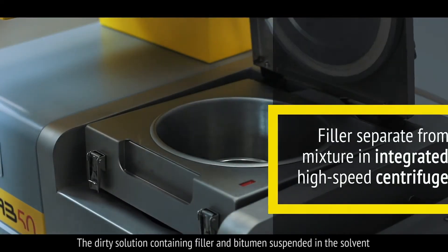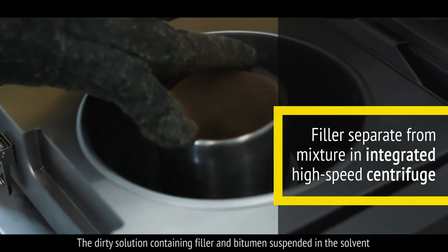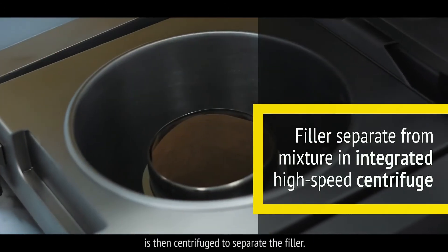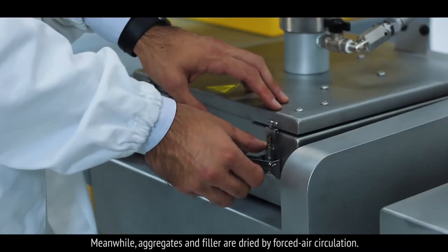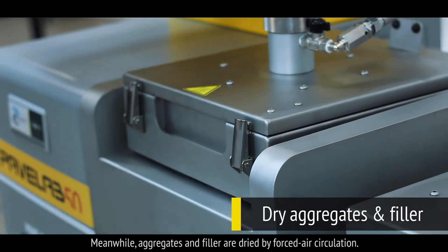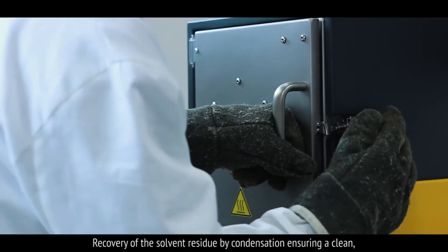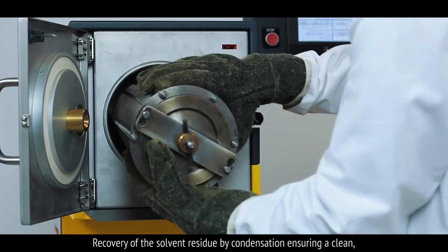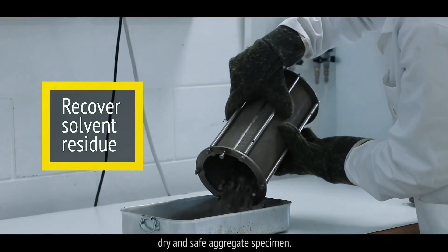The dirty solution containing filler and bitumen suspended in the solvent is then centrifuged to separate the filler. Meanwhile, aggregates and filler are dried by forced air circulation. Recovery of the solvent residue by condensation ensures a clean, dry and safe aggregate specimen.